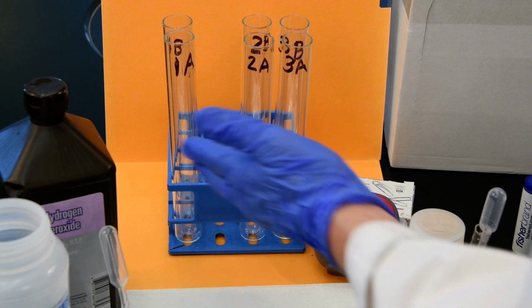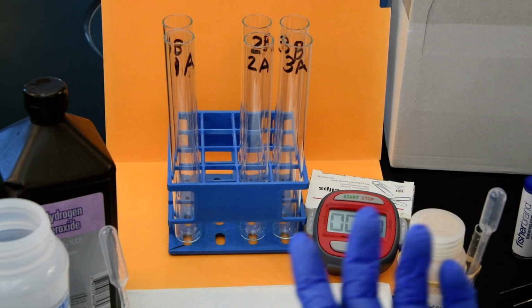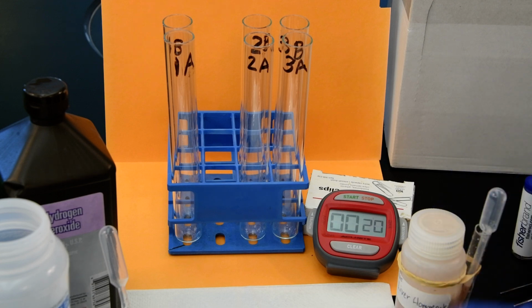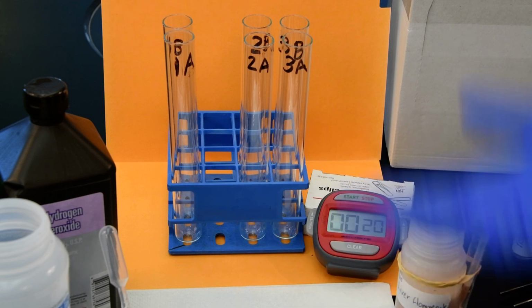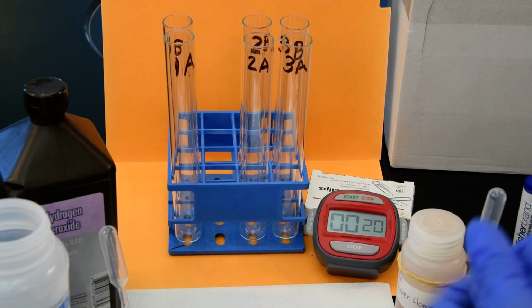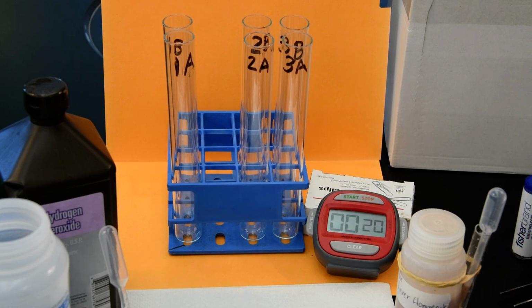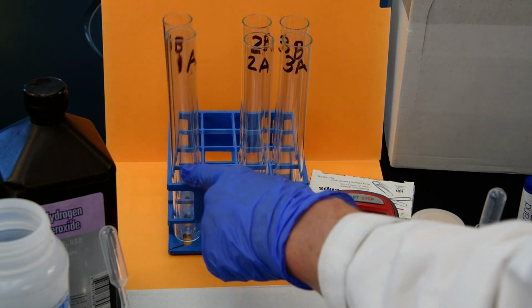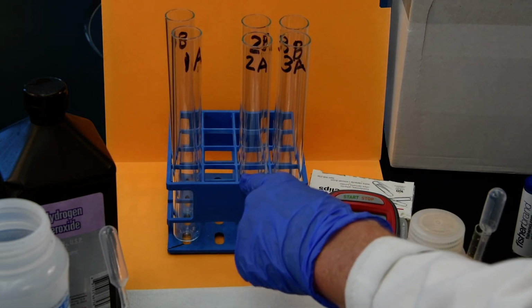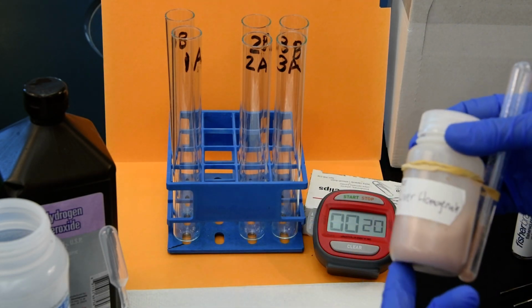So what we're going to do here is, again, we've got a little bit taller test tubes because, as you saw in the last video, when we reacted catalase with hydrogen peroxide, it really bubbled up very quickly and almost to the very top of the smaller test tube. So we've got a larger volume here, and we're just going to have a 1-time amount, 2 times, and 3 times. We're just going to do this by very crude volume changes.